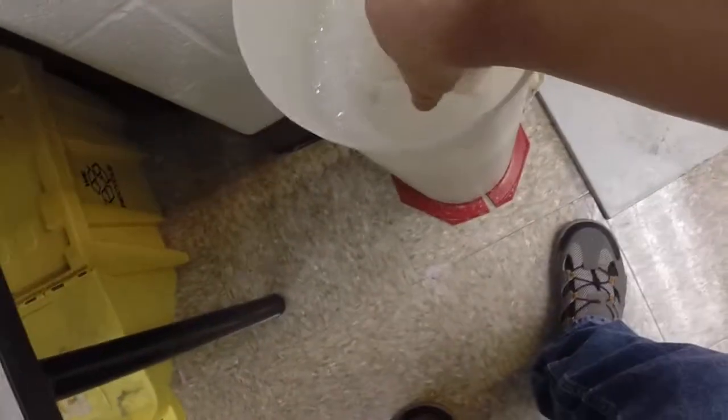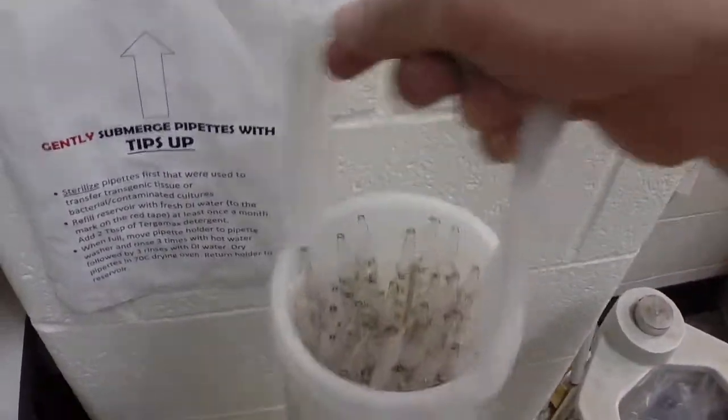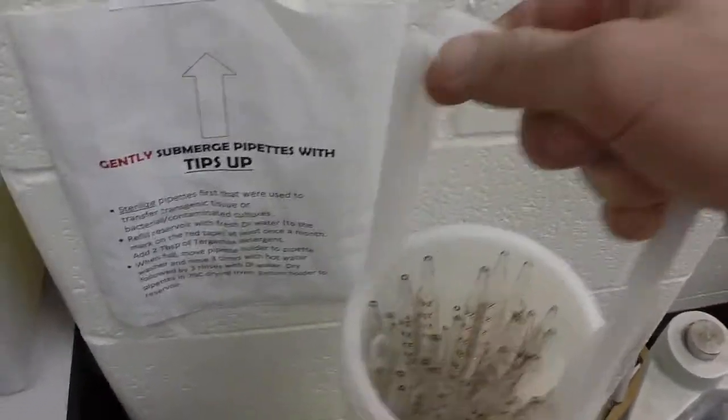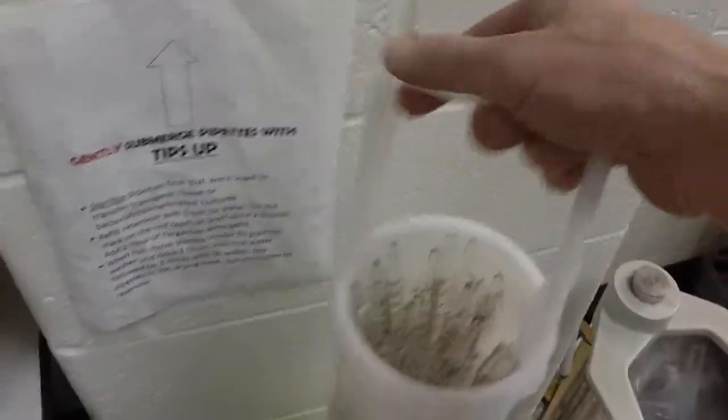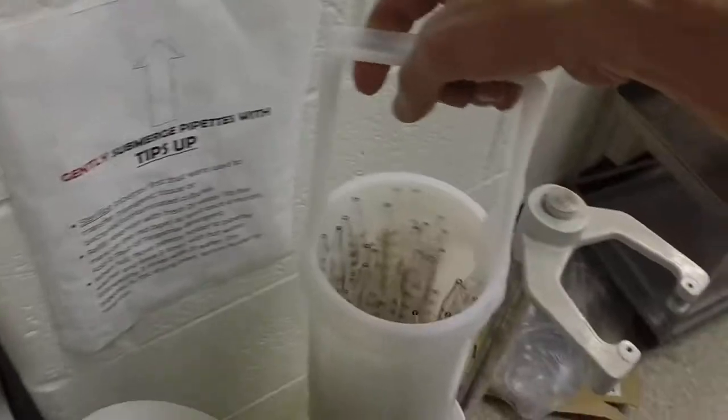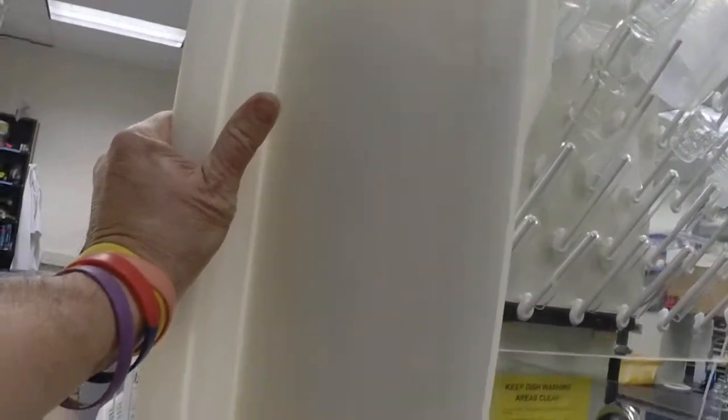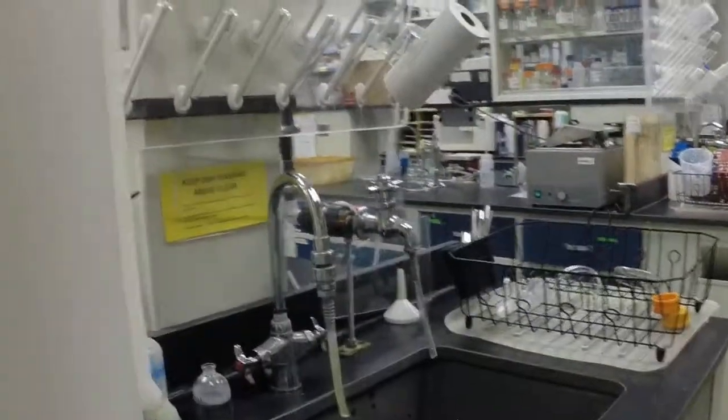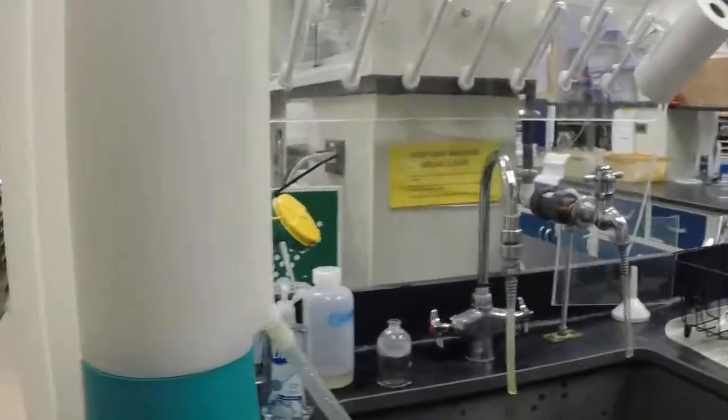I've actually run this through a couple of times already and run that out. I usually do that as many as half a dozen times. This now goes inside the actual pipette washer itself. The pipettes are up inside here, place that up on top of a sink area because the water is going to come out here.